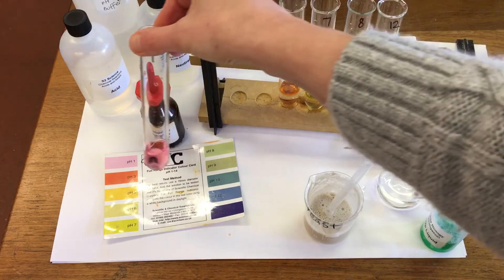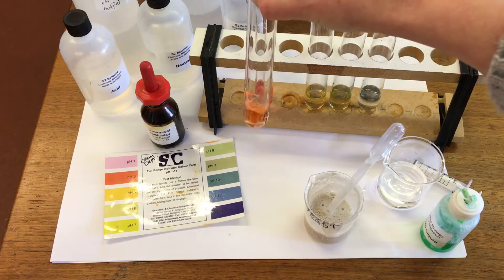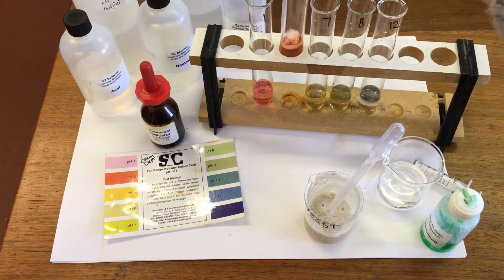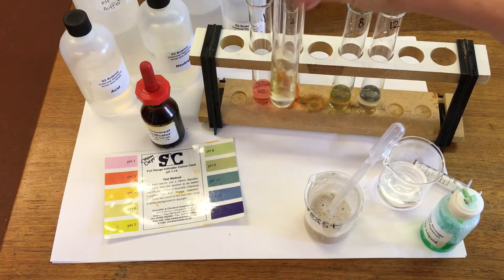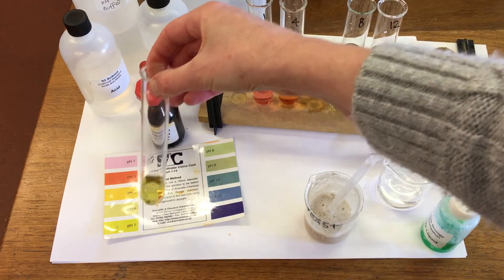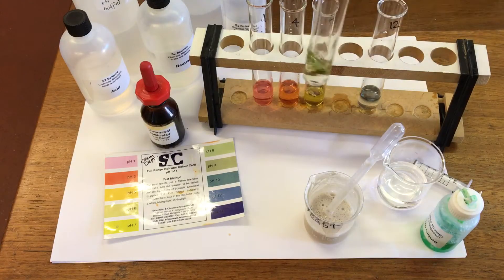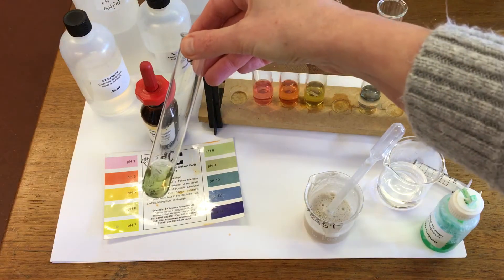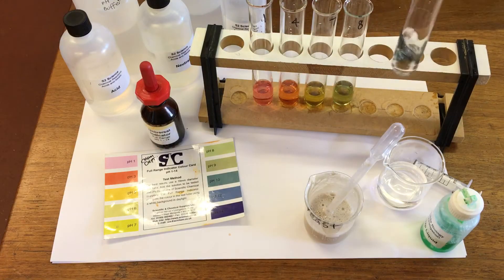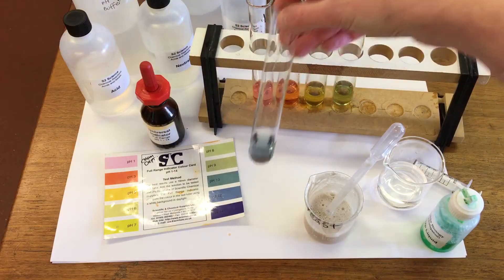So this one we've got pH 1, this one is pH 4, we've then got neutral pH 7, this one is pH 8, and this one is pH 12.